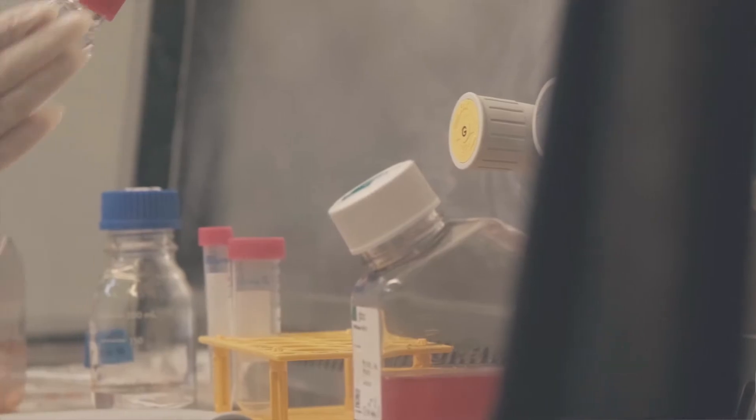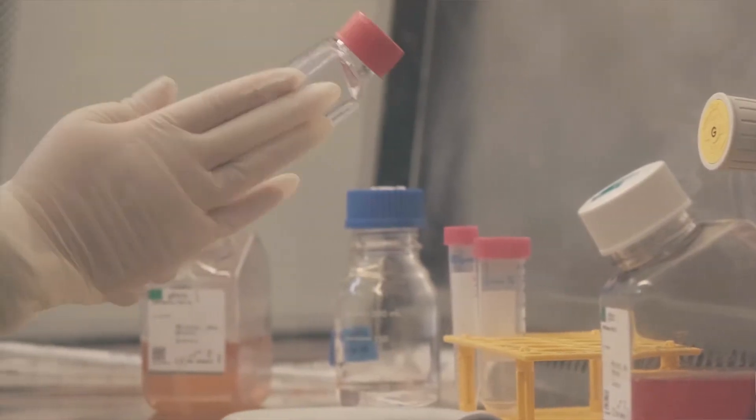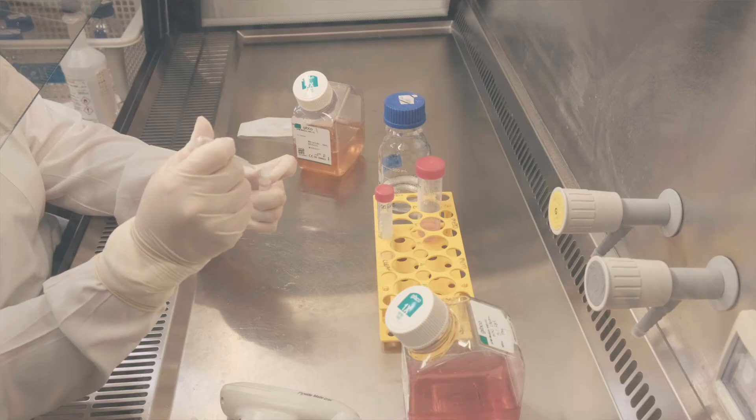We can also control airflow through the use of tissue culture cabinets. Air within these cabinets is first drawn through a filter and moves across the cabinet towards the user in a smooth laminar flow. The carefully controlled direction of this filtered airflow limits exposure to airborne contaminants.